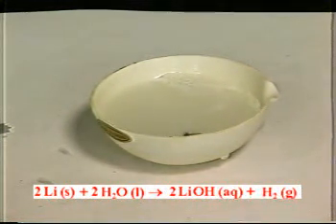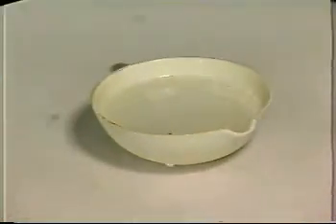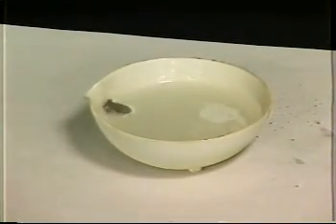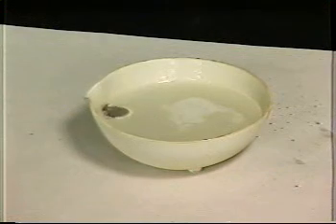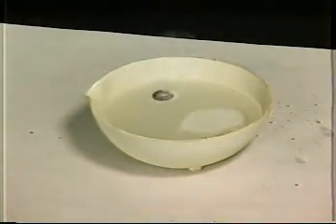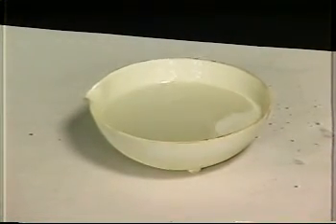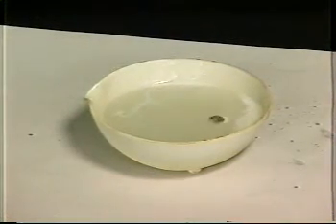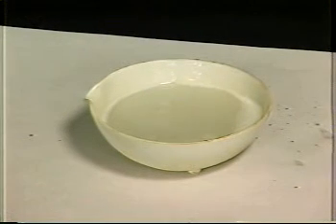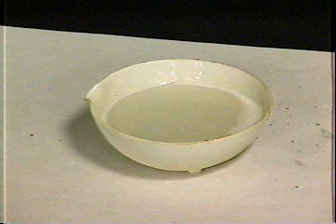Now you can actually see the hydrogen gas coming off the experiment. It's that smoke. That's the hydrogen gas. Now I'm going to turn up the sound coming from the experiment, and I want you to use what you see and what you hear to get an idea of the violence of the reaction. Alright, so you heard some fizzing going on and you saw the reaction complete.